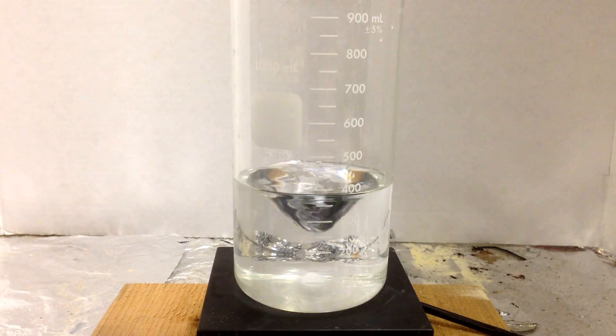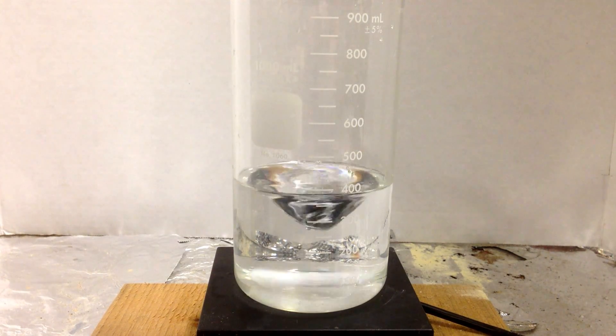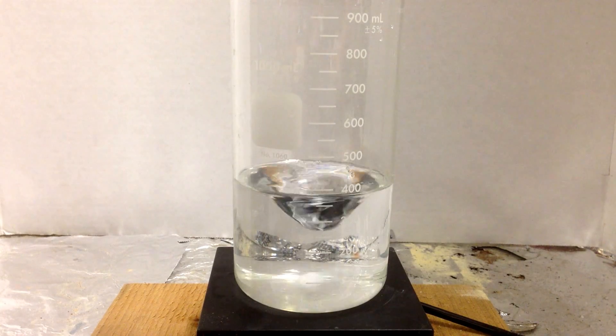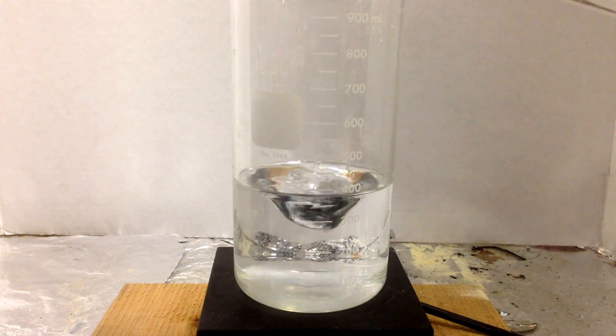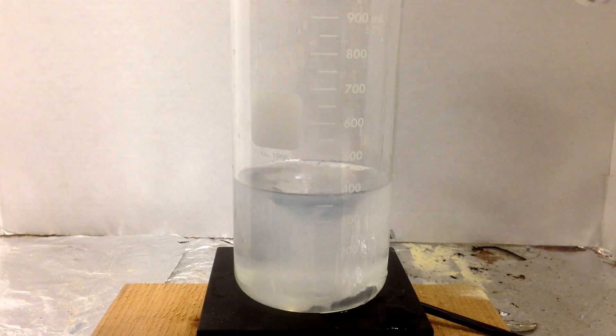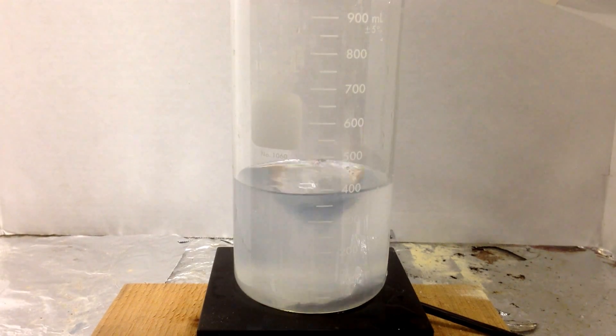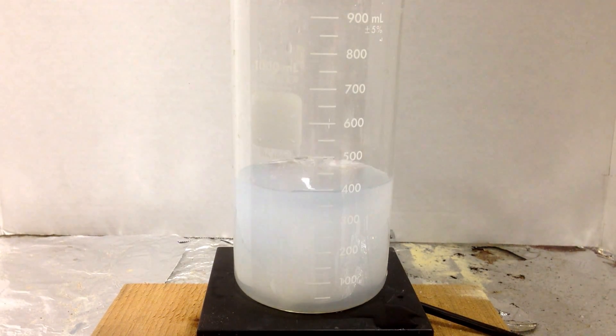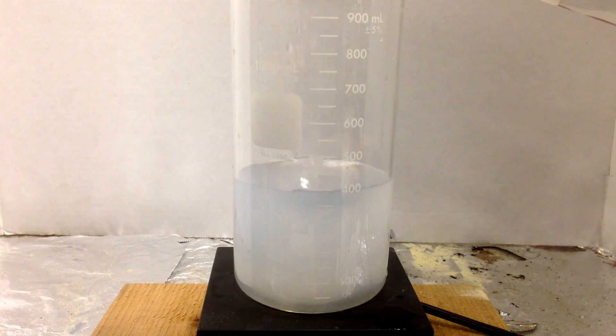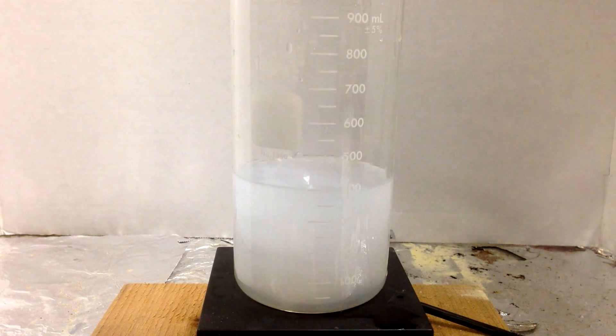Let's drop some base. Watch as we pull the H's away from the water molecules surrounding it. I'm using a pretty strong solution here. You can see that I've got some clouding going on. My strong base yanked enough of those H's and I've created a precipitate. There is a cloudy precipitate.